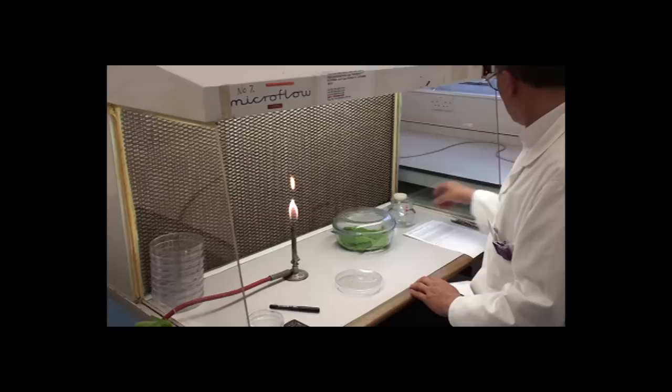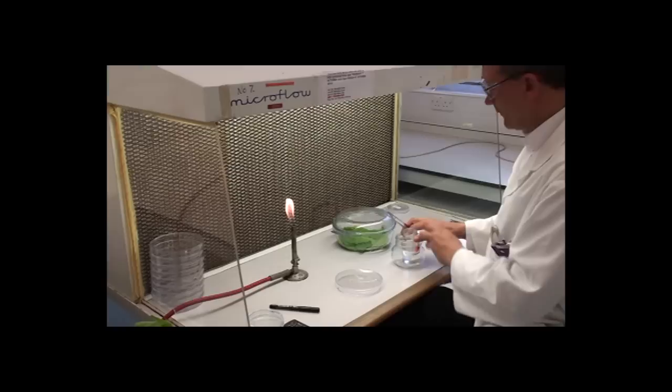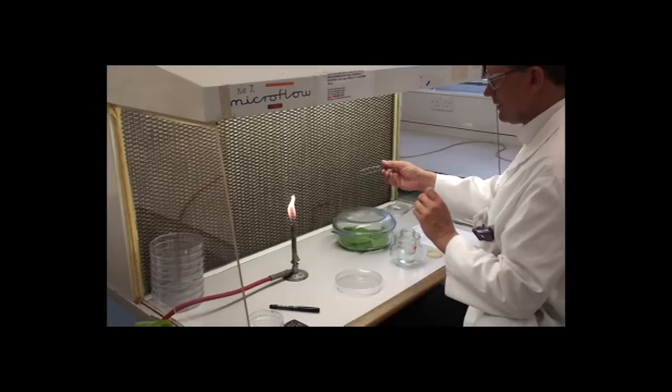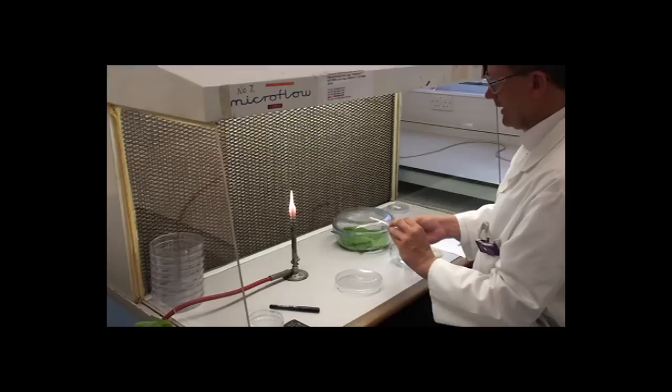First, I'm going to take the forceps and dip them into alcohol to sterilize them, as you're seeing here. And then they're flaming and burning nicely. I'll do the same thing then with the scalpel, which I'll be using for cutting.